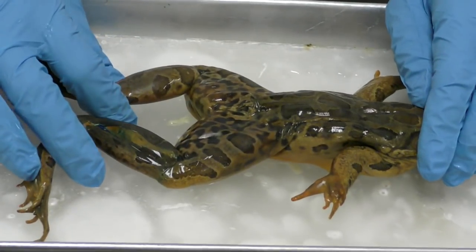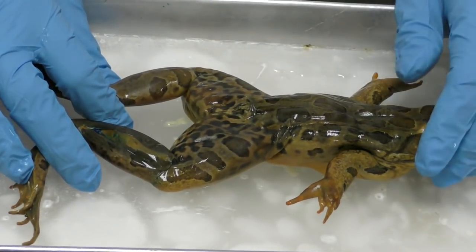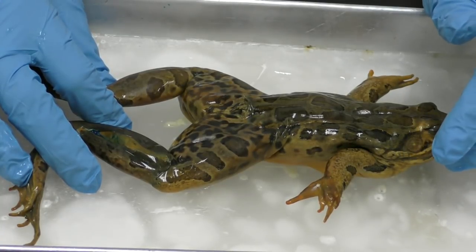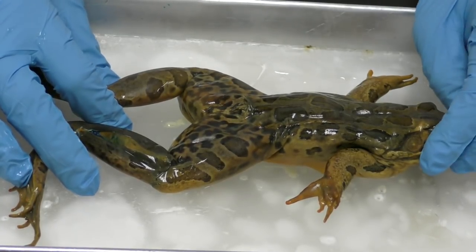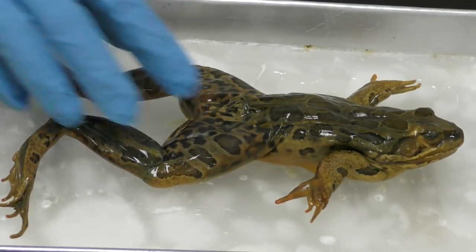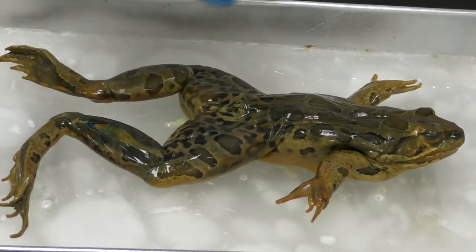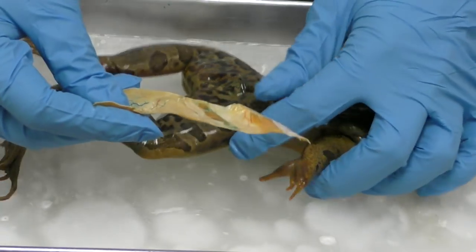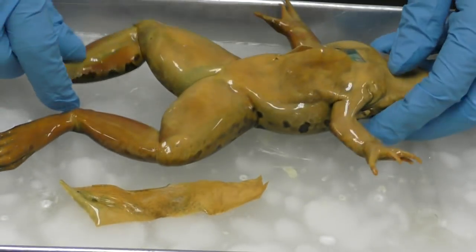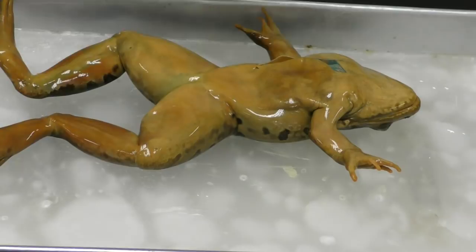So the first thing I would have you do is try to label that system. Okay, so I'm going to have you guys try to guess what that system is, what I'm pointing to. And I have 2 frogs, so this is the outer layer. I have 2 frogs, one that's partially dissected, and here I've taken some of it off of its ventral surface. Okay.